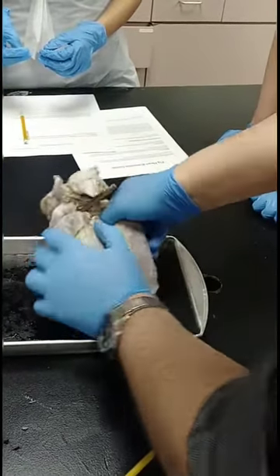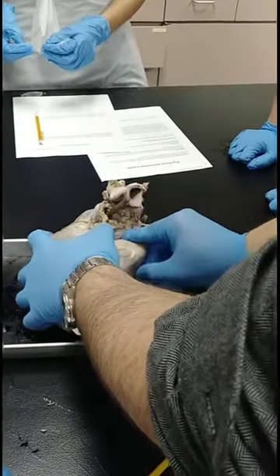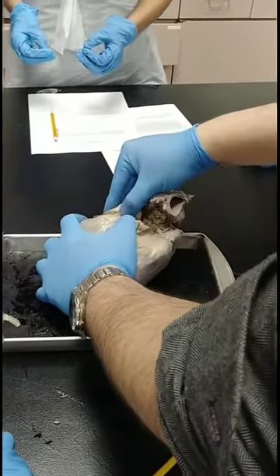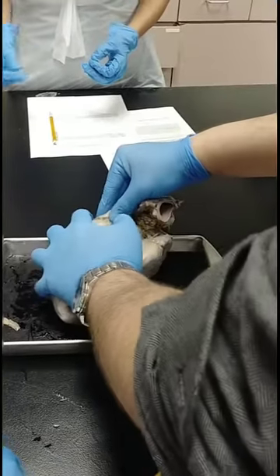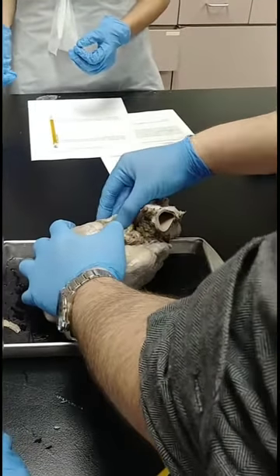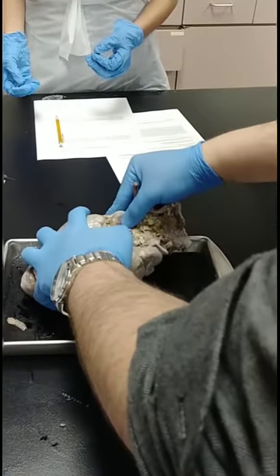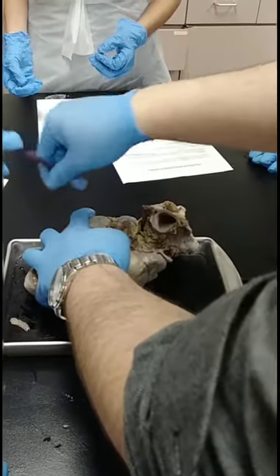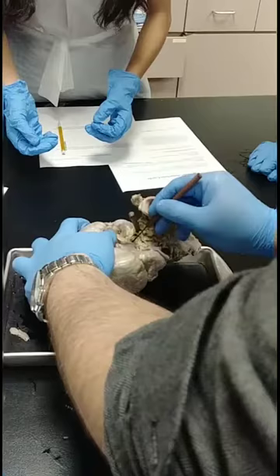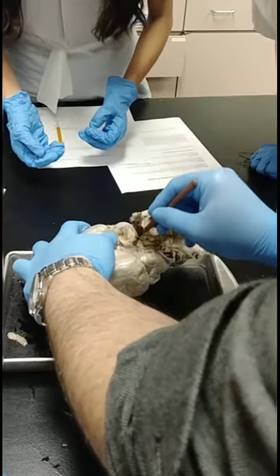Why do they soak it? So we can learn about them. This is what we're looking for — a very thin vein. This is one of our vena cava. See how thin this vein is compared to the aorta?